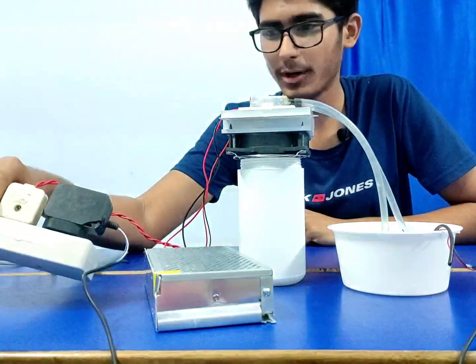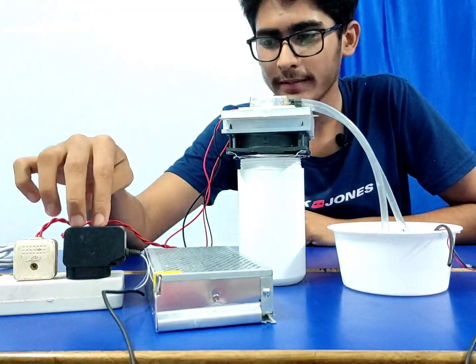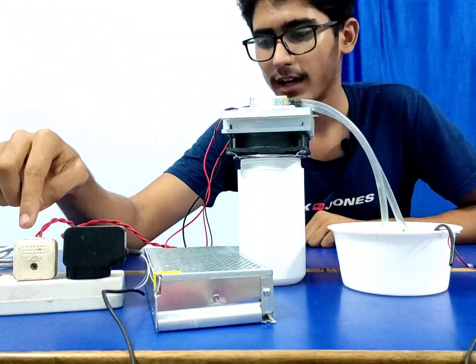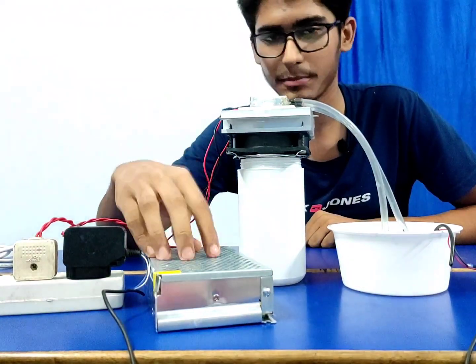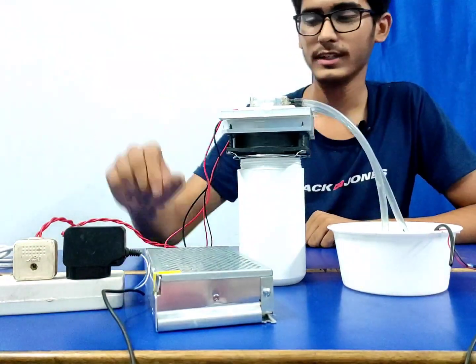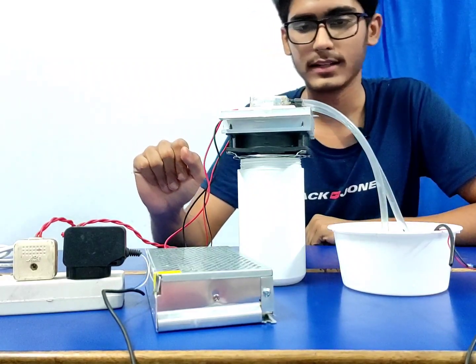If you can see the power cables here, I'm bringing it forward. Here's the AC power line. This is a 5-volt adapter for powering this small pump, and this is the power cord for the big adapter. It's 12 volt 10 amps. It's dangerous to work with, and it has all its connections on this side. I will not tell you the connections and complicate the video.